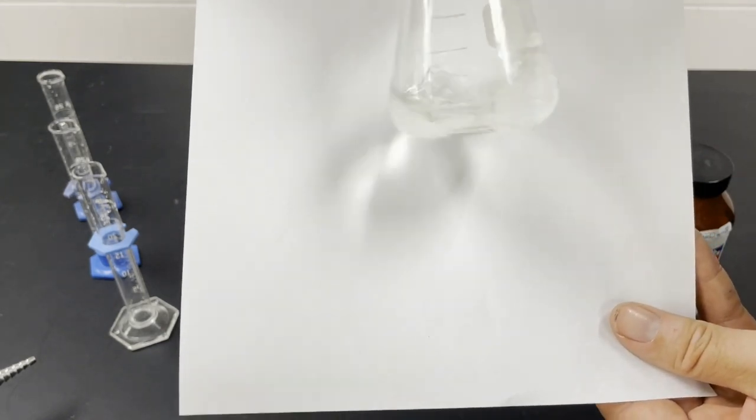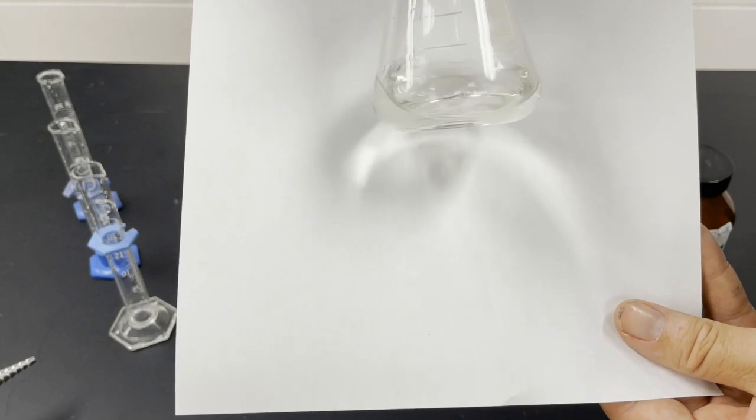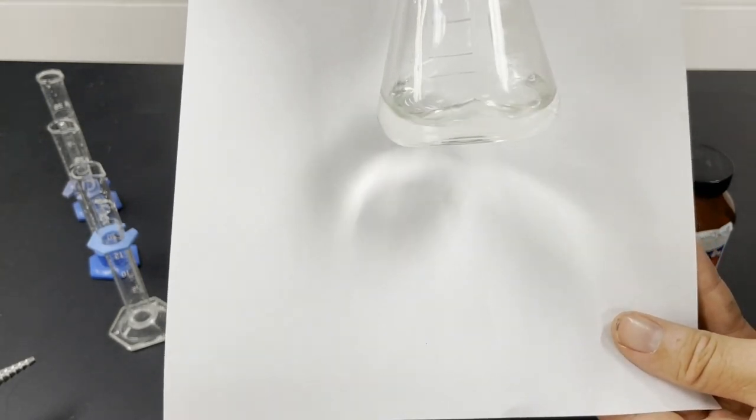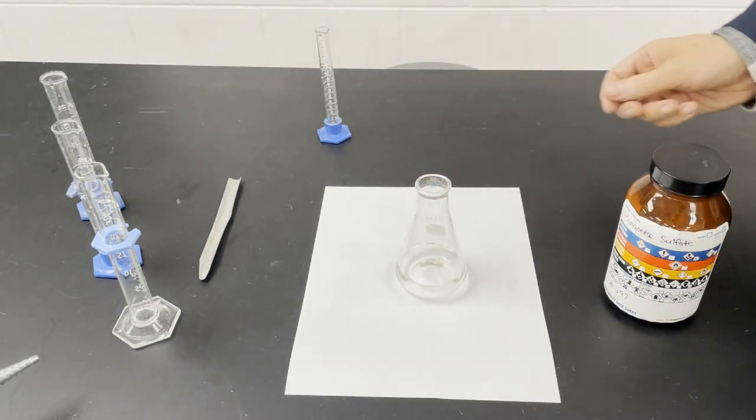Okay, wow, I already can't see any more pink at all. That's it. We're done. That was clearly not a possible catalyst, but a catalyst.